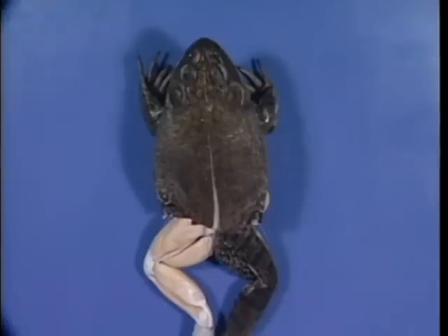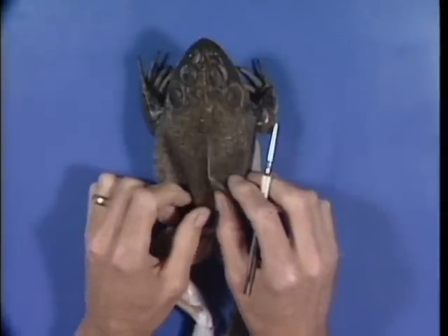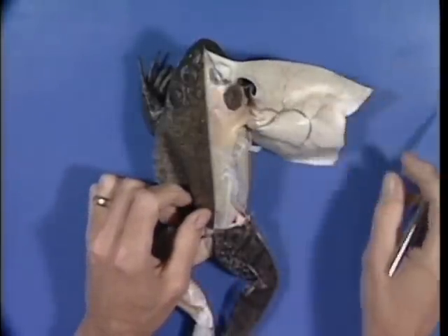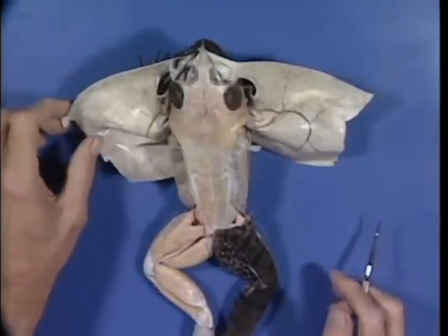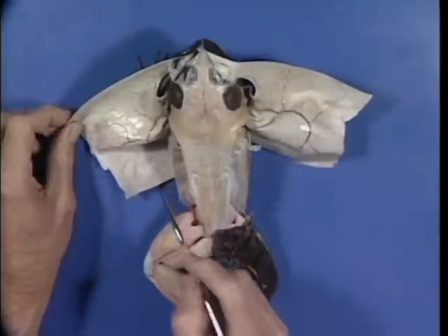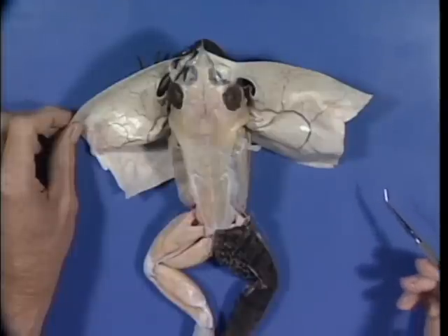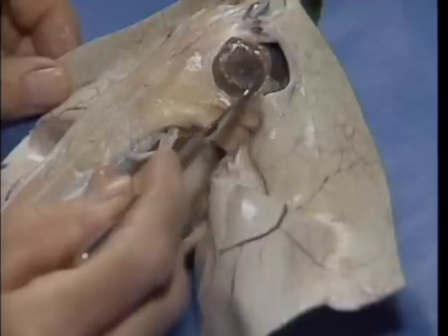Now that we have completed the hind limbs, let's examine some of the major muscles of the dorsal surface of the head and trunk. To do this, go ahead and remove the skin from the dorsal surface of the frog. As you remove the skin, note again that it is quite well supplied with blood vessels. Use care in removing the bands of tissues which connect the skin to the connective tissue covering the musculature. Leave the skin around the tympanum in place.